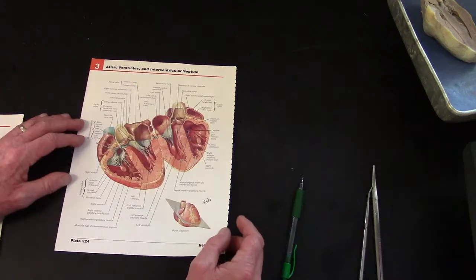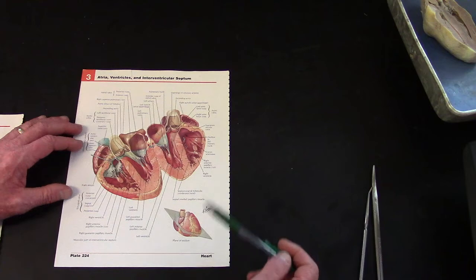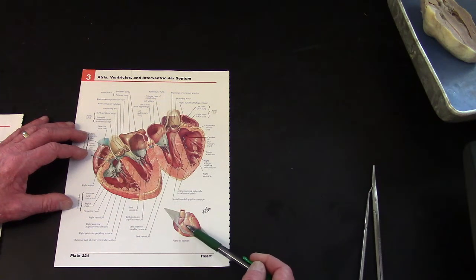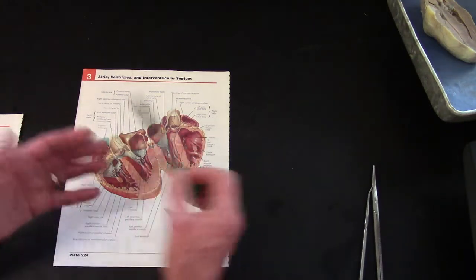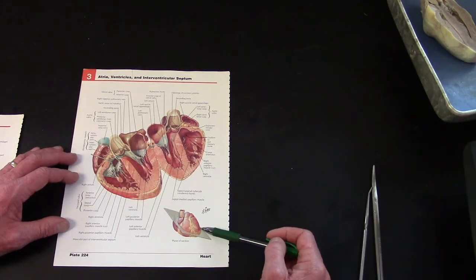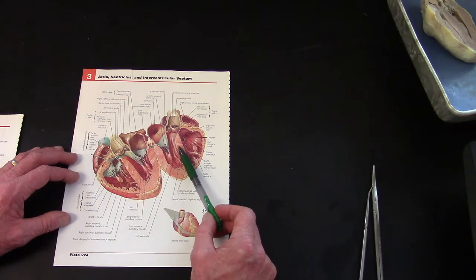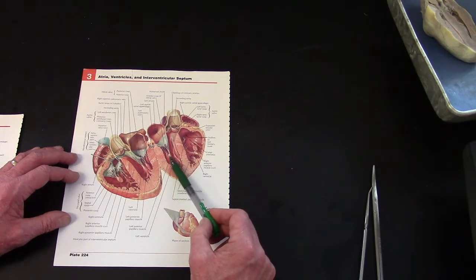So here are a couple of pictures out of Netter, and this illustration just shows a section through the heart as if you took a knife and sliced it as shown in the plane. Left ventricle, right ventricle, and they left it attached on the left ventricle and just folded the two halves apart, which would be over on this edge. So at any rate, there again is the interventricular septum, thick, forming the wall of the left ventricle on both sides.